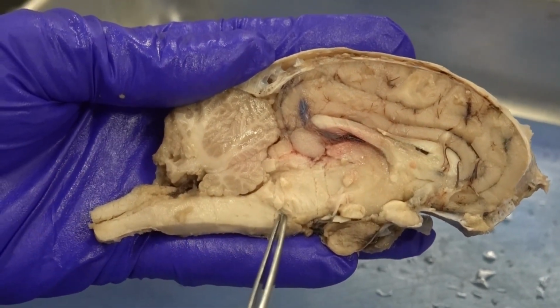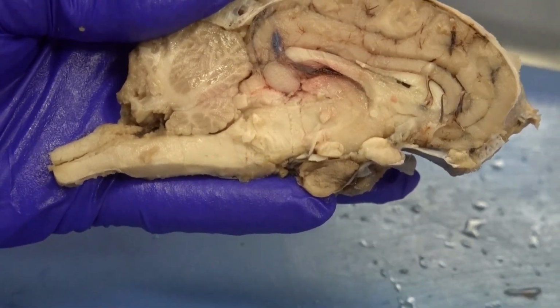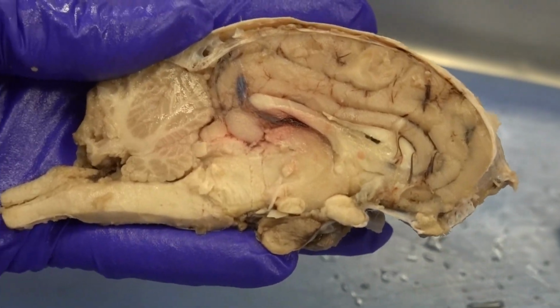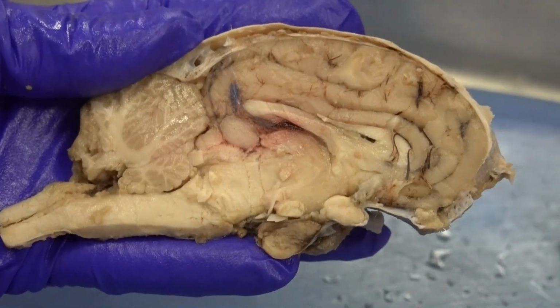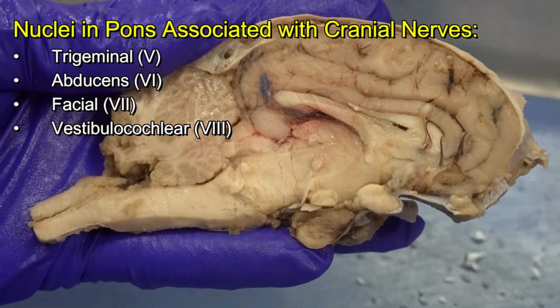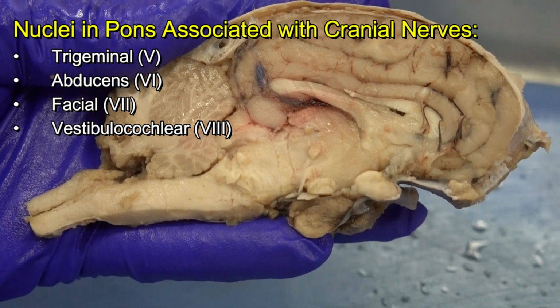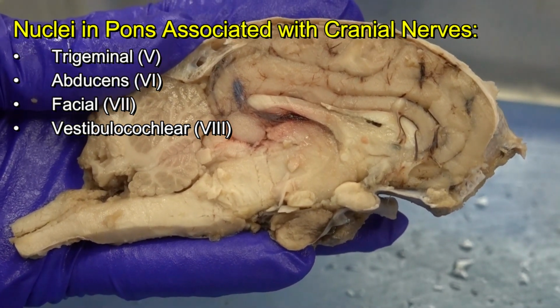When we get to the pons, we notice that aside from some nuclei for different activities, which I gave you just one example, like the pontine respiratory group, we also have nuclei that are associated to cranial nerve number 8, vestibulocochlear, cranial nerve number 7, facial nerves, number 6, abducens nerves, and number 5, which would be trigeminal nerves.